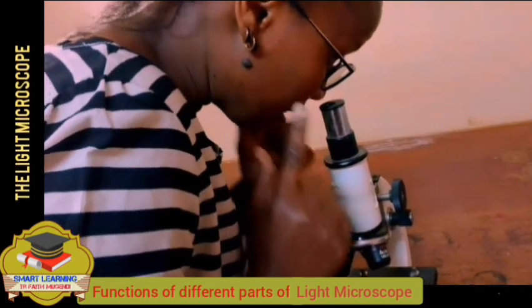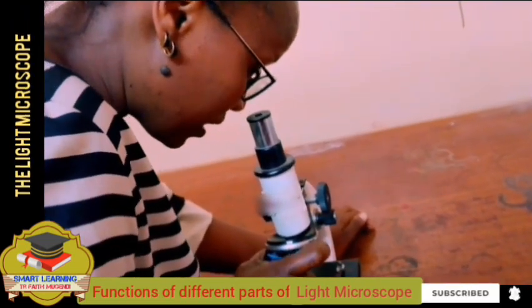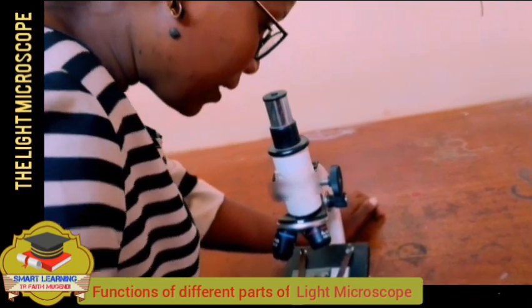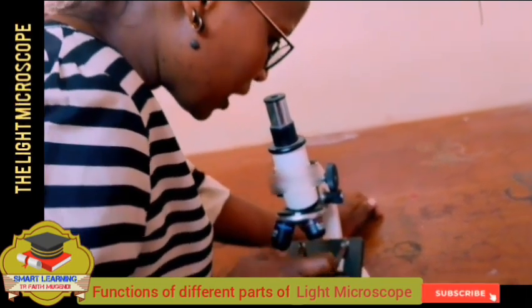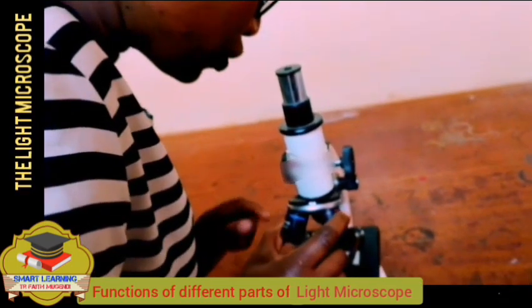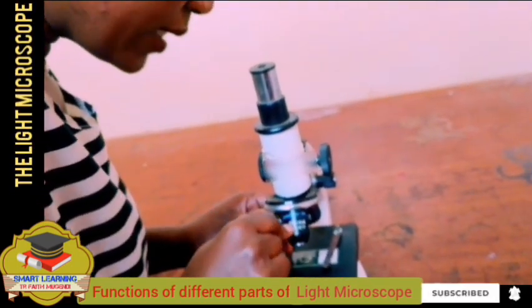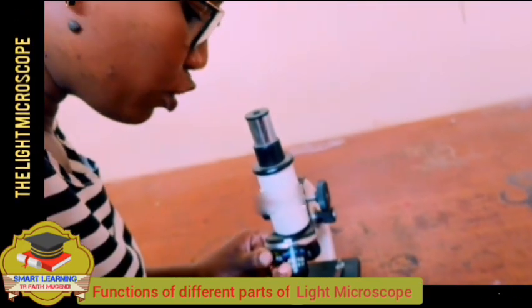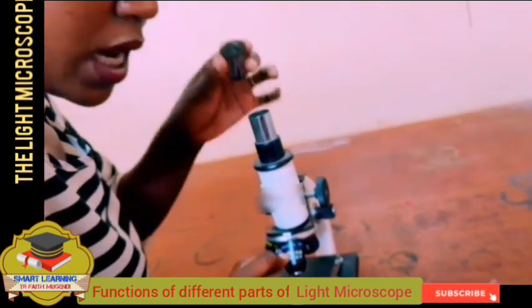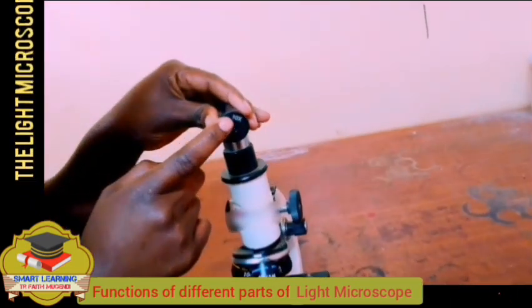So whatever I see is the magnification of the objective lens, the one that I choose, and then the image formed here is further magnified by the eyepiece. Suppose we choose an objective lens that has a magnification of times 40, and we have an eyepiece of magnification times 10.